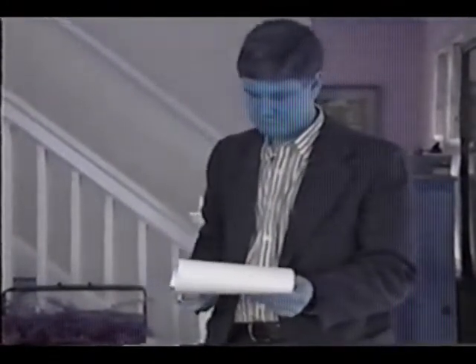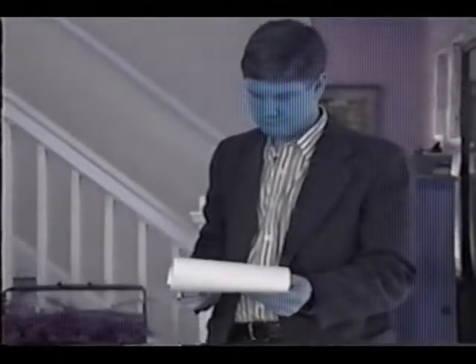Label the tube and put the sample number from the laboratory submittal form on the label and on the field sampling form. Each sample number must be unique. Also on the field sampling form, record the name of the room, surface type, and surface condition.